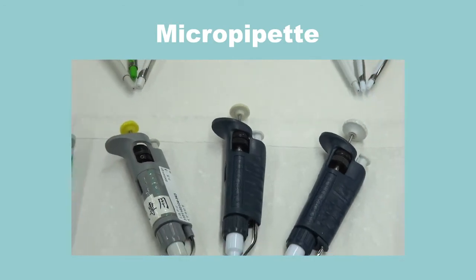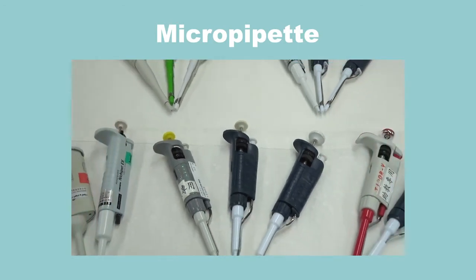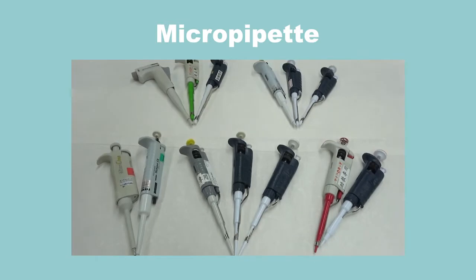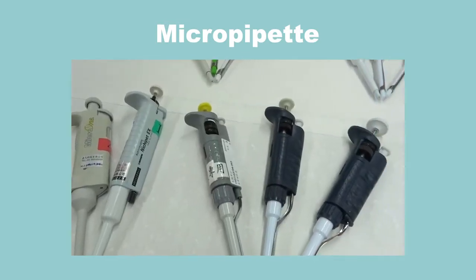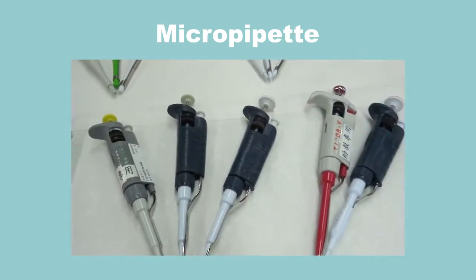MicroPipet. The MicroPipet is used for aspirating solutions at the microliter scale. It is an essential tool for biochemistry experiments.